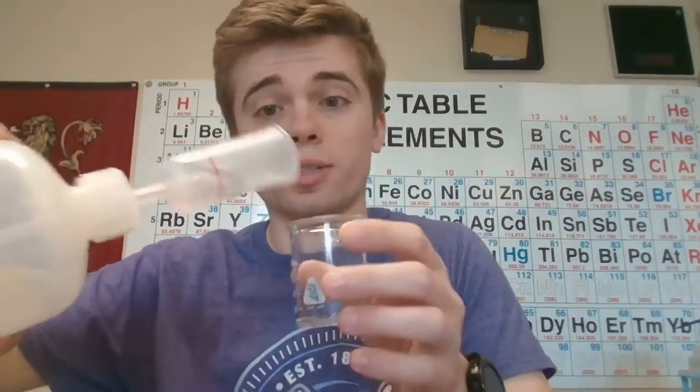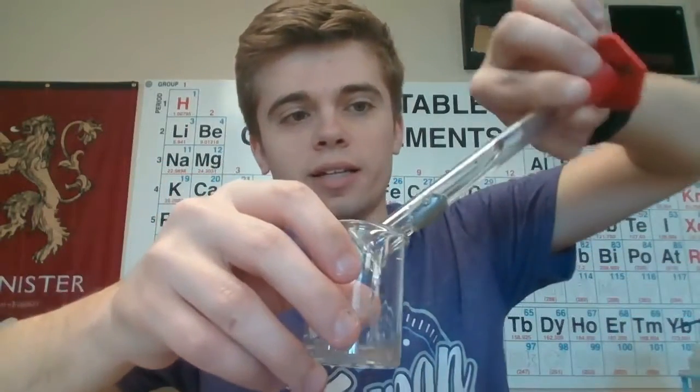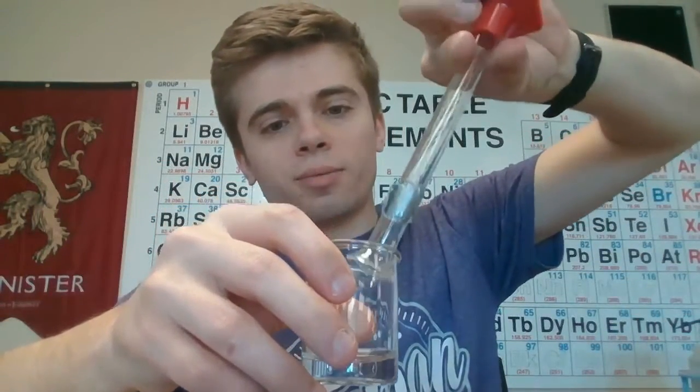Okay, now we're doing our fourth trial where we still have 10 milliliters of B, so we're keeping that the same each time, and I've measured that out here. But now we're going to have 7 milliliters of A and 3 milliliters of water, which I've gone ahead and mixed into here, so I'm going to dump that in here. And we're going to do the exact same thing. We're just going to look for how long it takes, after I mix these two, to turn blue. So I'm going to mix them now, so start your time.